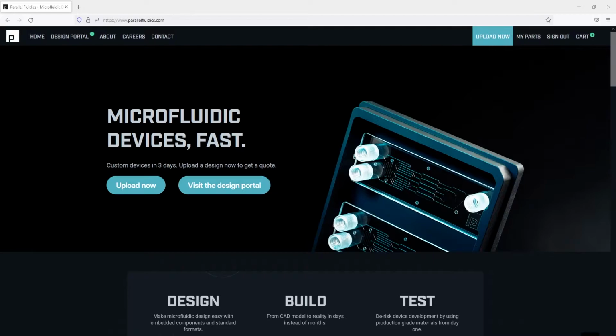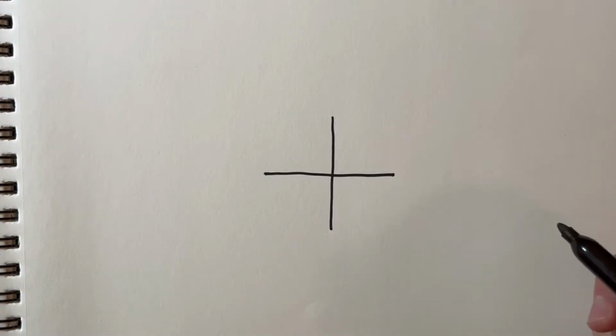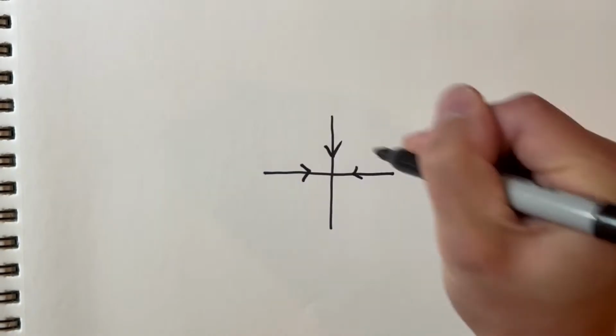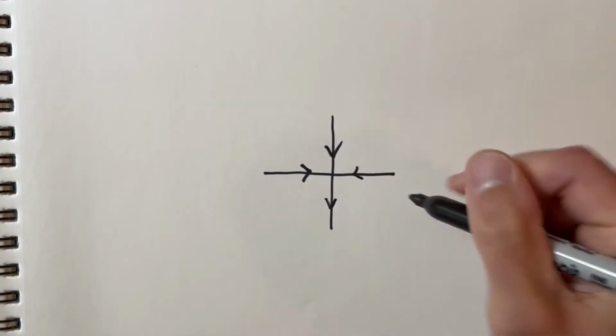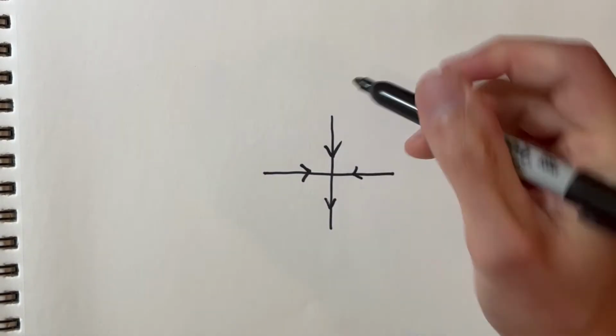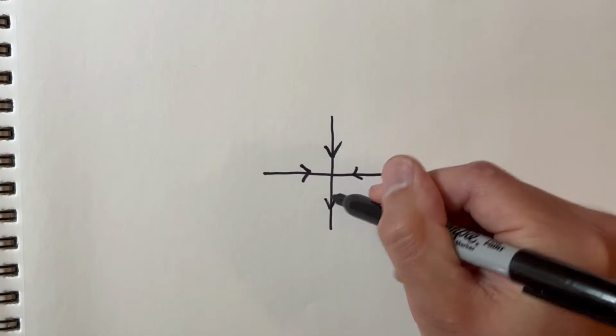First things first, it's always a good idea to lay out a schematic of your device on paper before we start designing in CAD. This device will be a cross-style droplet generator. Let's start by sketching a basic cross in the center of the page. We know that we'll have fluid coming in through the right channel, the center channel, the left channel, and then exiting through the bottom. Oil will be coming in through the side inlets, and water will enter through the center of our nozzle geometry, which we'll later design in CAD. The water and oil will combine in the nozzle and send droplets out through the exit.